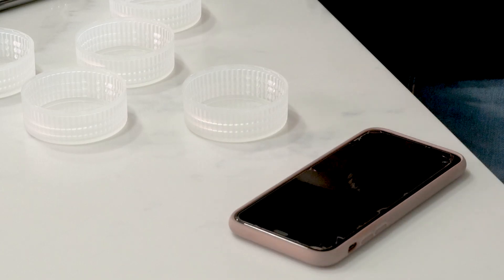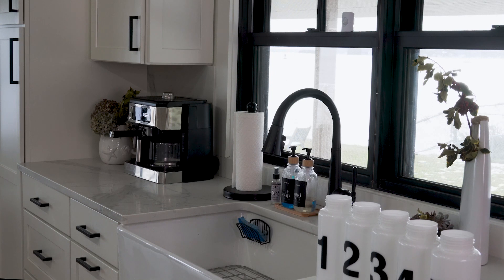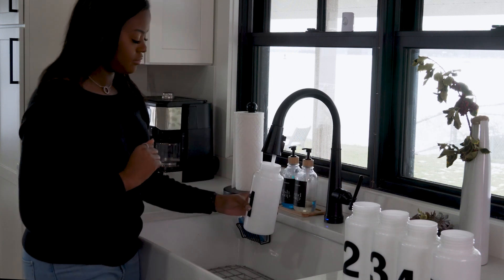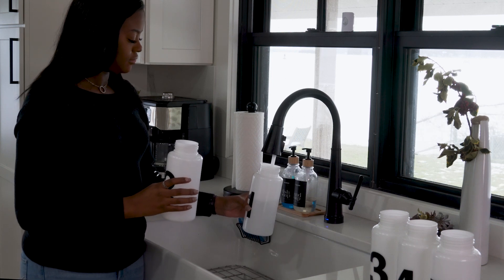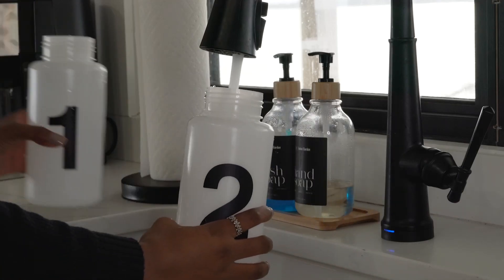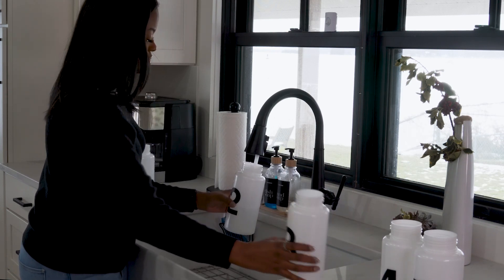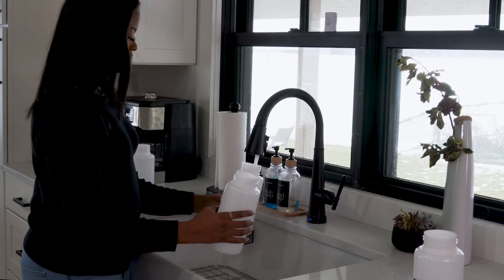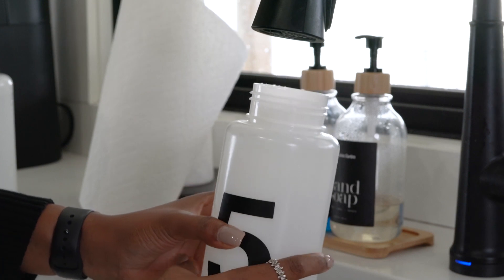When you are ready to begin: first, write down your start time. Secondly, place the first bottle below the faucet and do not touch the inside of the bottle with your fingers or the faucet itself. Turn the faucet to cold water to start immediately filling the first bottle. Run the water as you fill up a glass of water and let the water run continuously as you collect all five samples. Try not to lose any water when transferring between bottles if possible. Have the next bottle in the other hand or have someone ready to hand the bottle to as you finish up the previous bottle. Fill the bottle to the bottom of the neck of the bottle.